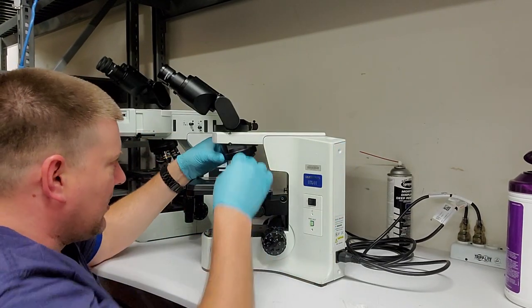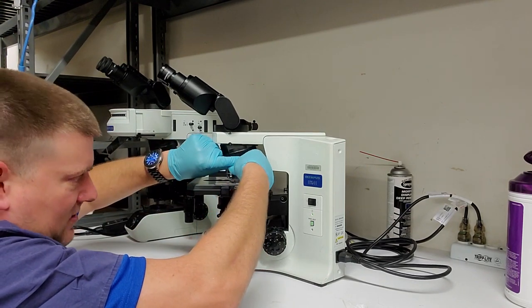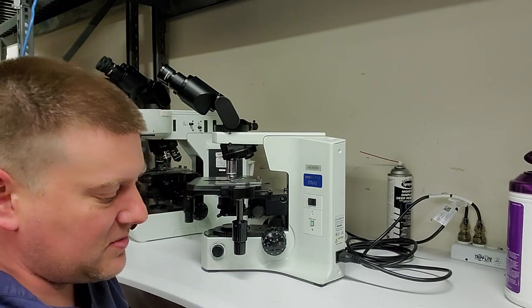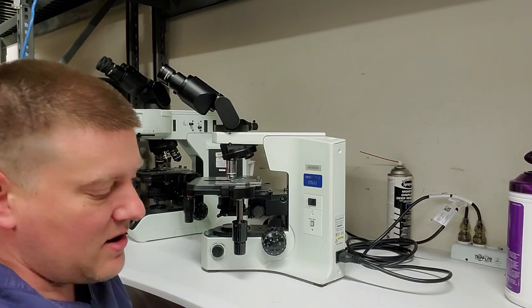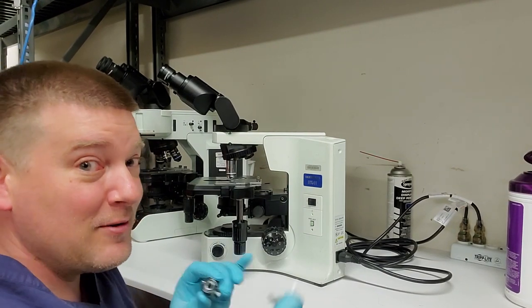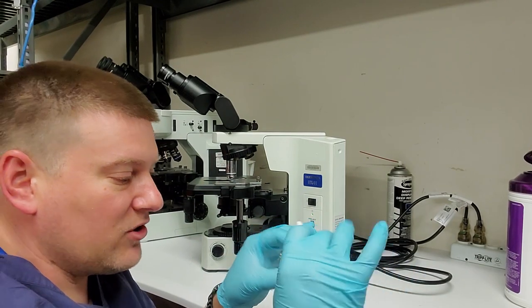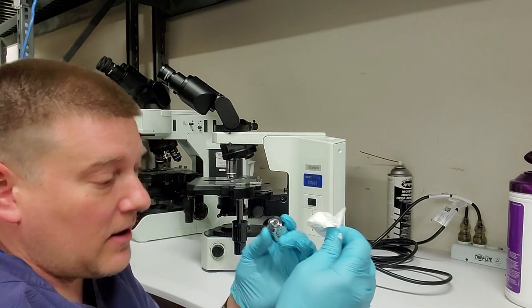The next thing that we are going to do, I'm going to take these objectives off. And remember where you took them off, because that's one way to piss off your customers, if you take them off from someplace and you put them back in the wrong order. Remember, these guys use these microscopes all day long. Some of these doctors have very particular settings. So what I'll do is the same thing as with your oculars. I'll take the objective off. I'll give it a swipe. Don't shove nothing down the back. It should be clean. That's why we got clean gloves, right?